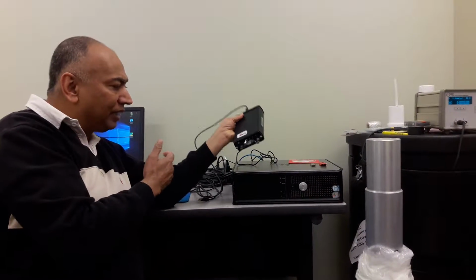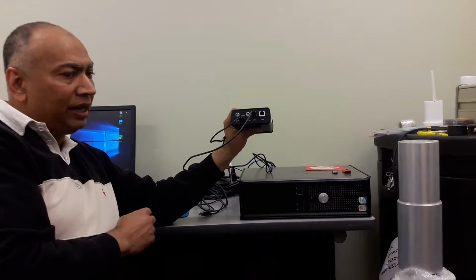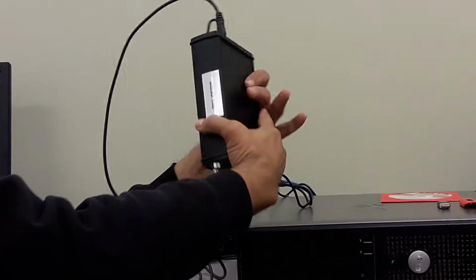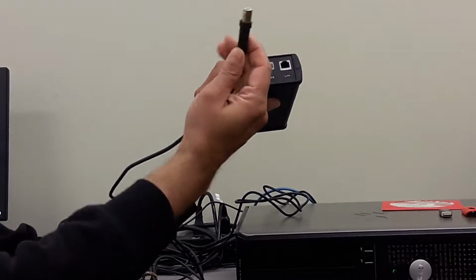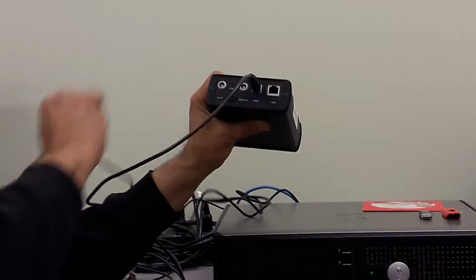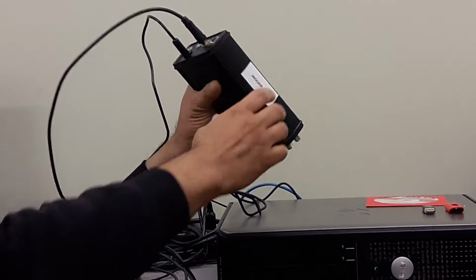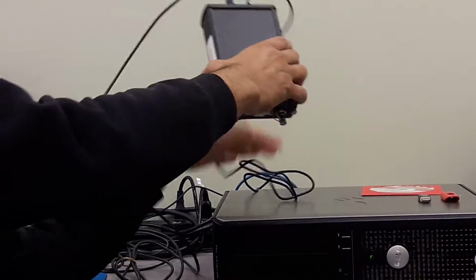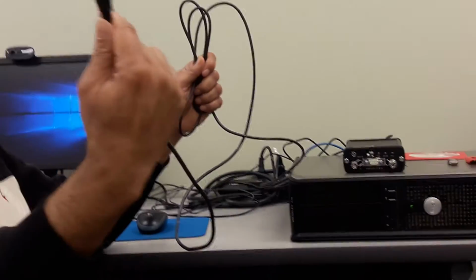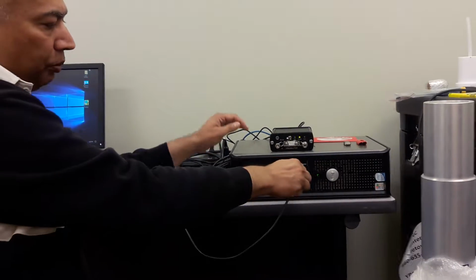So this is a very nice digital MCA, and in the first phase of our work, we are going to connect this MCA system with the computer using a standard USB cable. So you're going to have a standard USB cable like this, plugs into the USB port, and then this is our charger cable. I want to keep the MCA charged as I'm working with it. And then we are going to connect the other end of the standard USB cable, which is like this, to a USB port in my computer.